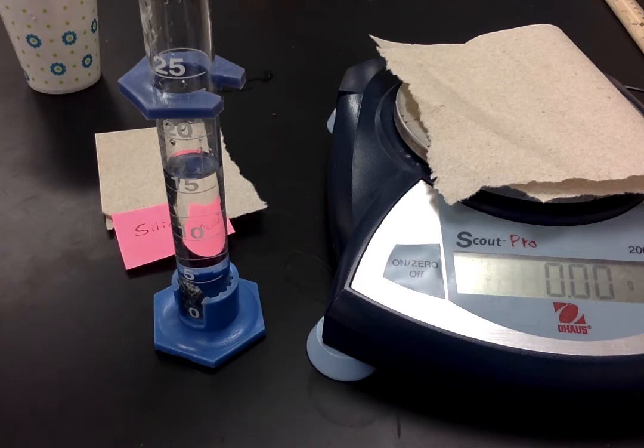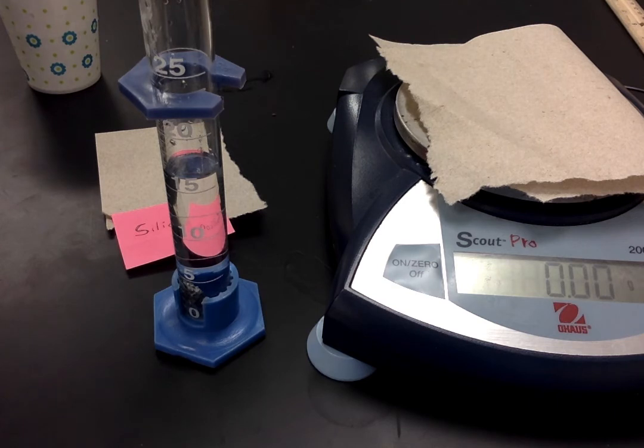I'm getting it at 16, is it 16 even or 16.9, or 17 even? I think I'm going to say 16.9 milliliters. Okay, so record that before and after volume on your lab sheet.